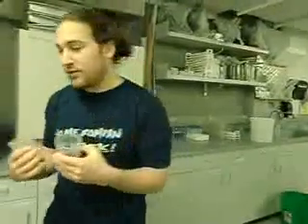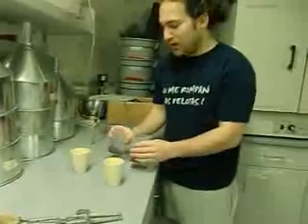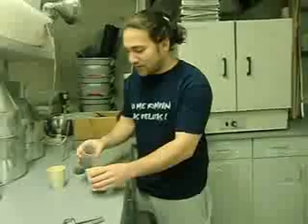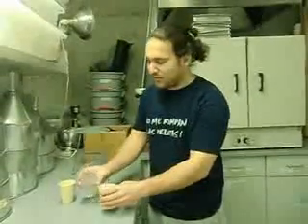Now that we have our completely non-moist samples, we are going to, ooh, look, there's a worm in this one. Crazy. You mean the heat hasn't killed it? Well, the heat typically will kill it, but since we didn't heat it that much, we'll cut this part out. Alright, so we have our soil samples, and we're going to dump them into these clay cups.